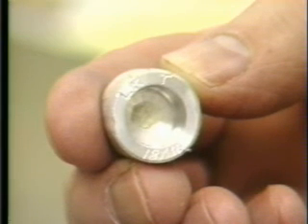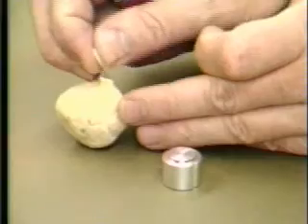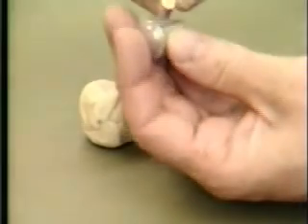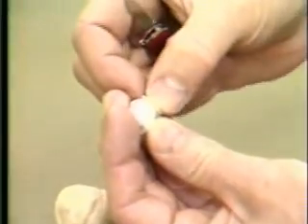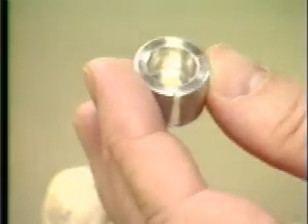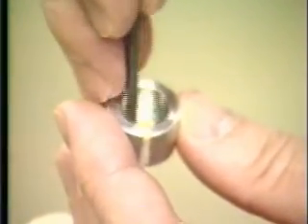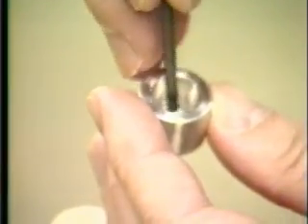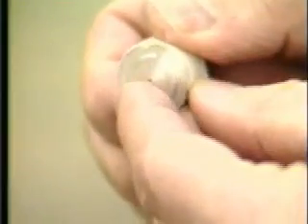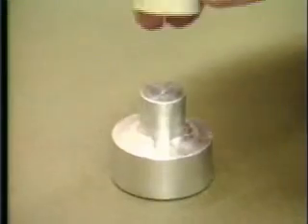In preparing the head mold base, it's a good idea to etch the size and species of fish into the base. The two grooves in the base should be filled with modeling clay to prevent leakage of the casting resin. Trim off any excess with a sharp knife. Put another small lump of clay inside the head mold base to seal the area around the needle. Push the head mold base onto the casting jig. Insert the blunt end of the needle containing the fish head through the hole in the head mold base and into the hole in the casting jig.